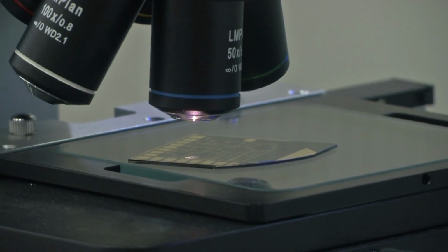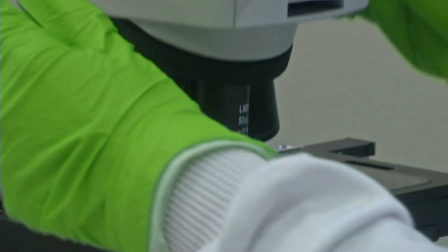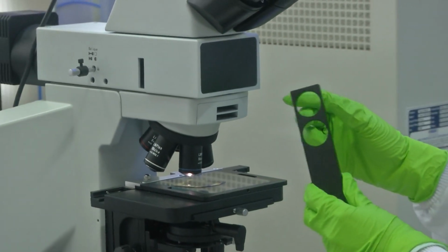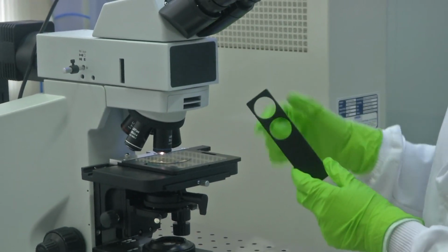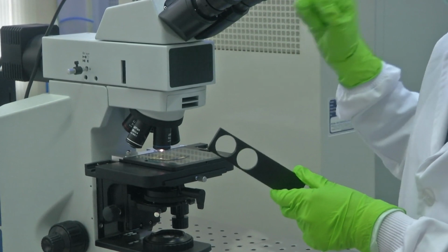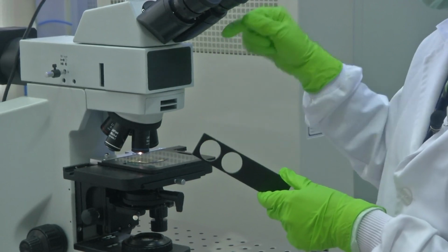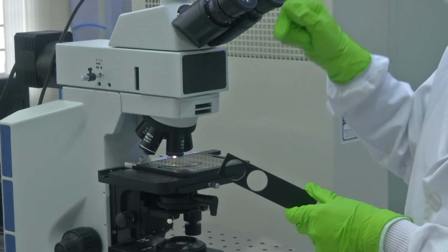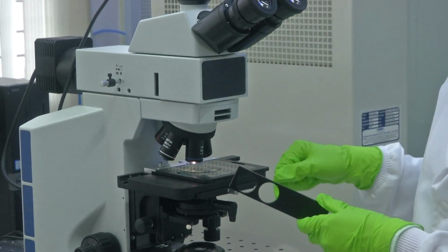So, another utility what the metallurgical microscope has is a slot here. So, this is to adjust your aperture, and another function what the slot could provide here is filter. You could filter light so that based on application different wavelength or the required wavelength could be used, and then that particular wavelength of light is actually which flows onto your sample.